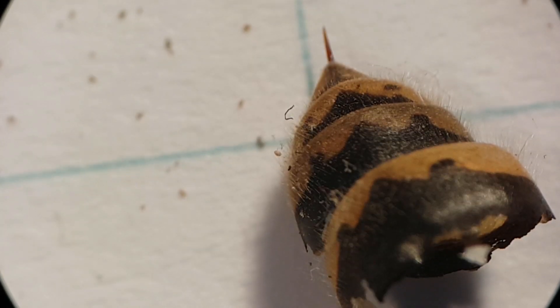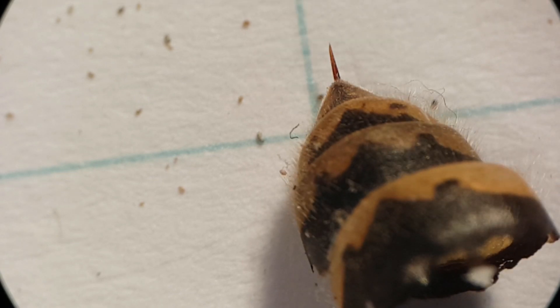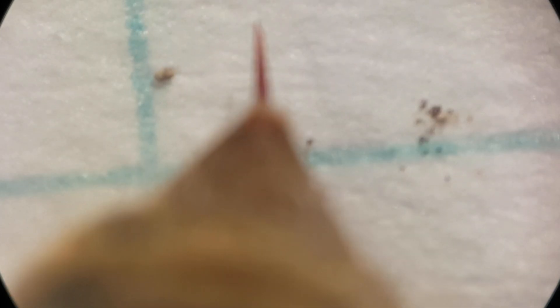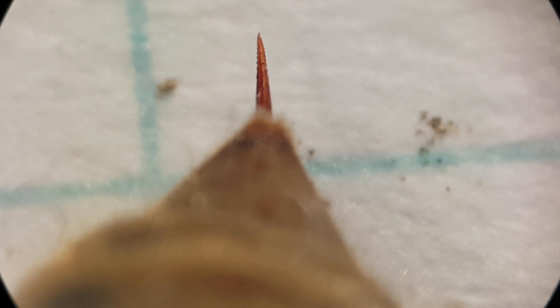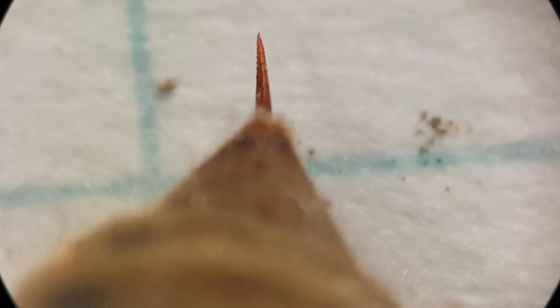The abdomen of this wasp has split in two, but I do have the other side still. Let's see if I can get it in frame — there it is. As you can hopefully see when I focus, it still has its sting right there. Let's see if we can do something fun with that at a higher magnification. As you can see, it has little hooks on the end of the sting so it sticks inside whatever poor animal it chooses to sting.